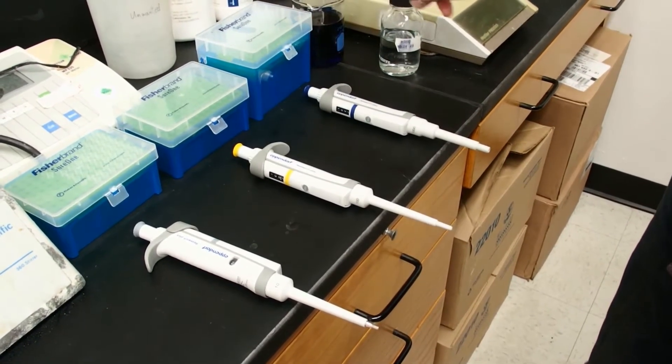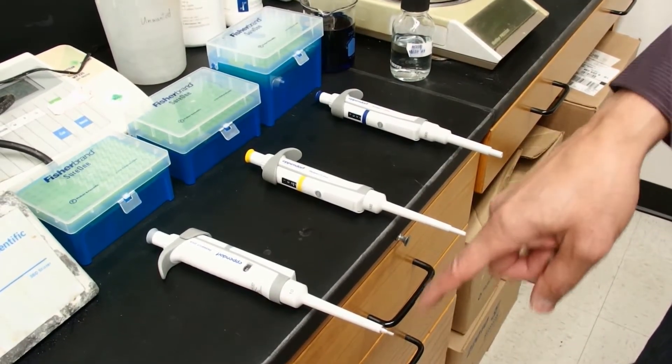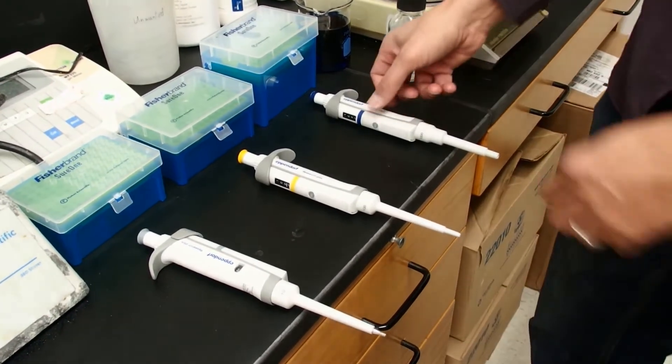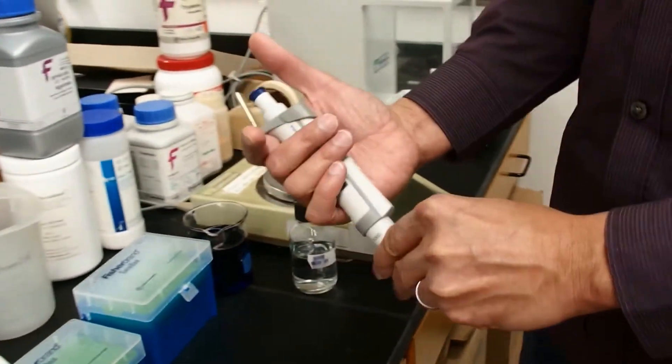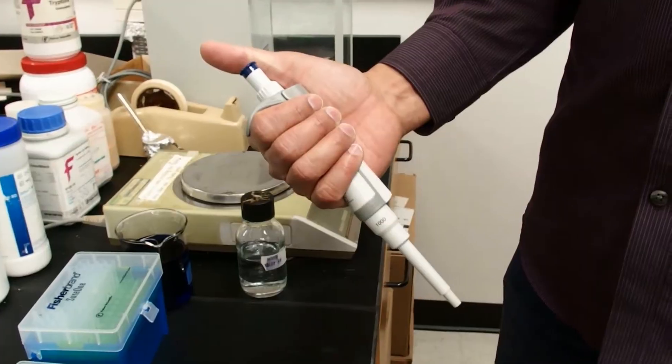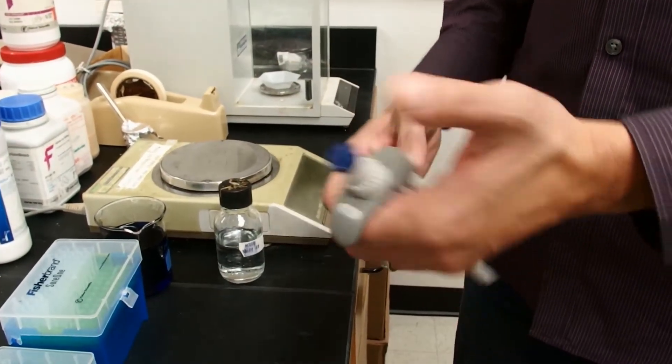They each use different tips that fit onto this end of the pipette. So let's talk about the parts of the pipette. First, you're going to hold the pipette like this. If you're left-handed, you'll hold it the same way.